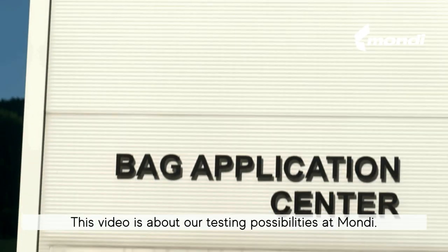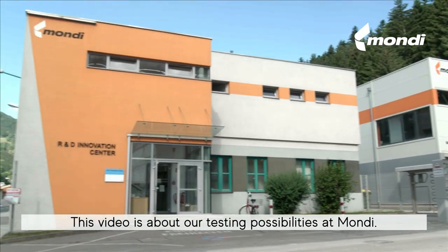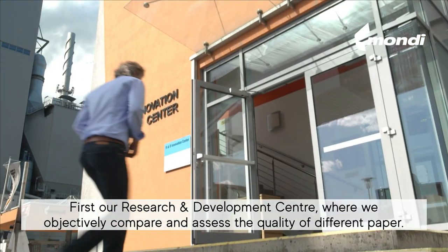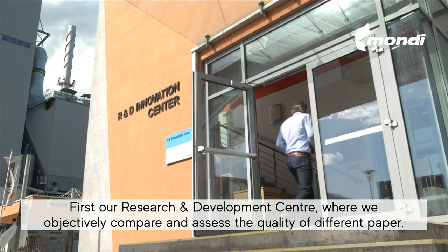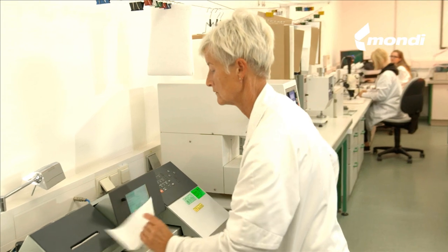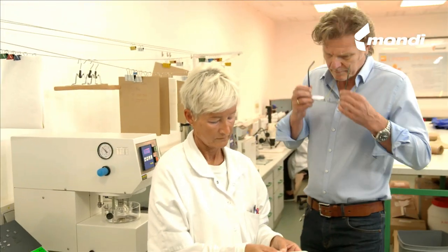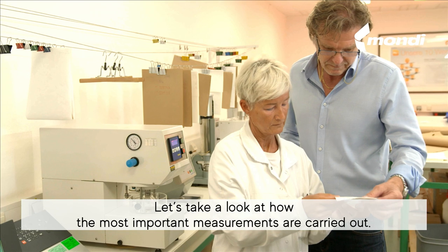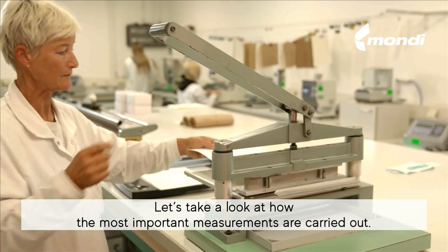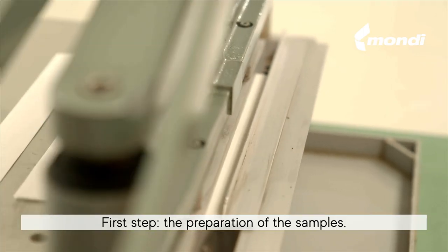This video is about our testing possibilities at Mondi — first, our research and development center, where we objectively compare and assess the quality of different paper. Let's take a look at how the most important measurements are carried out. First step: the preparation of the samples.